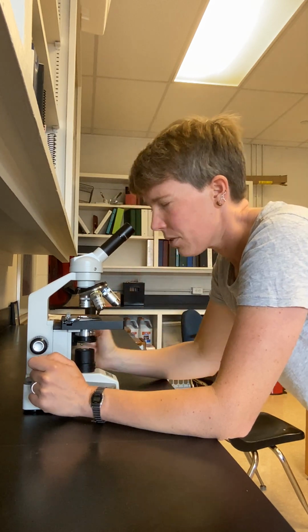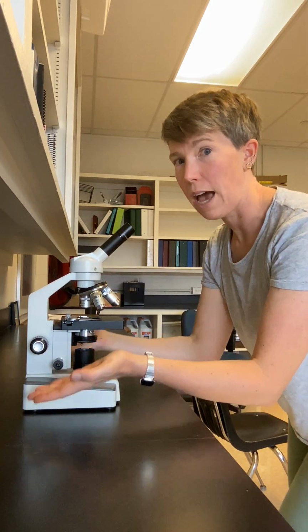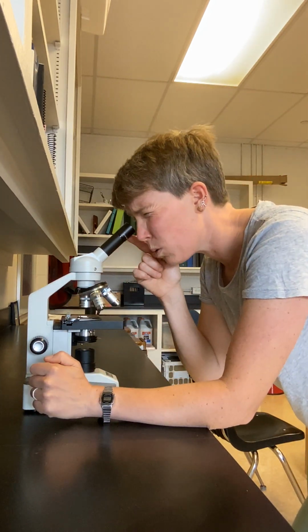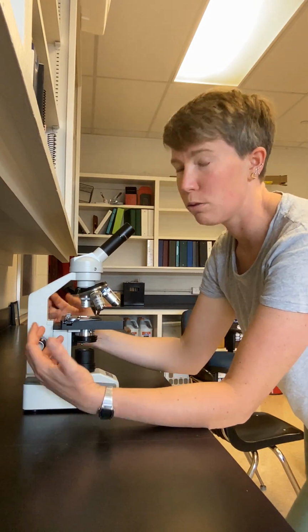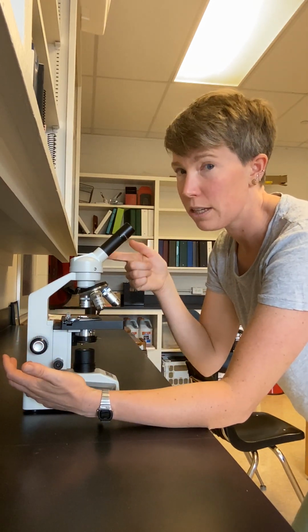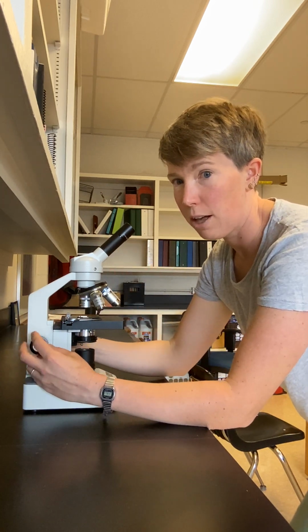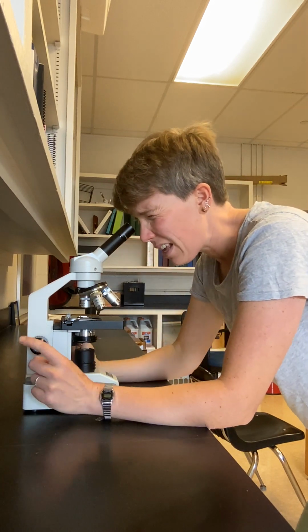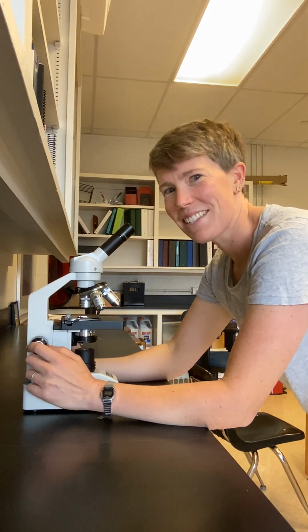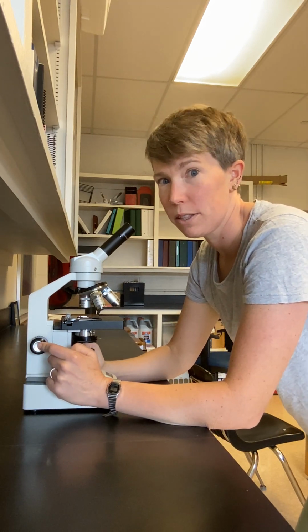through the ocular lens. It's super important that as you're raising the stage, the entire time you raise the stage, you look through the ocular. You'd be surprised how many students try to focus a sample without actually looking through the ocular lens while they're changing the focus knob. So keep your eyes on the prize through the ocular lens while you raise and lower the stage, always with the coarse focus to begin with.